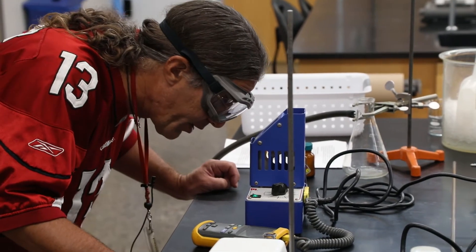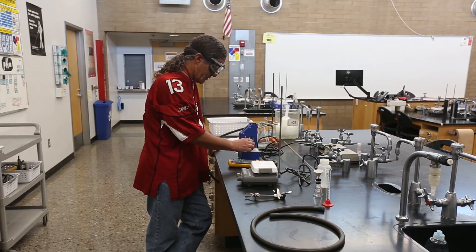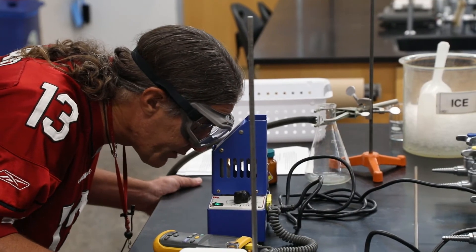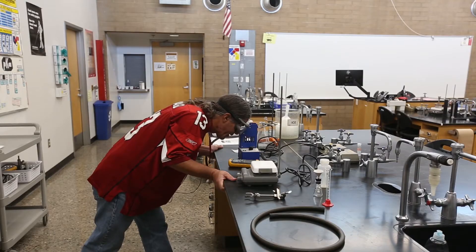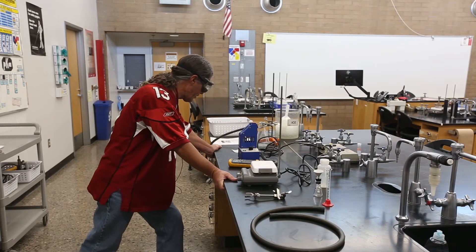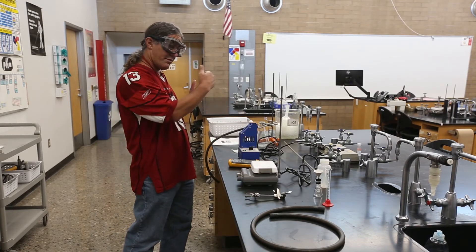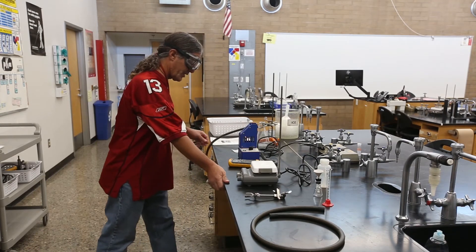Still solid at 83°C. I'll bump the setting up to about 3.7 — I want the temperature rising slowly when it melts, but we can't spend all day watching a solid. The idea with salicylic acid recrystallization is to dissolve it and then re-precipitate it as large pure crystals by changing conditions.